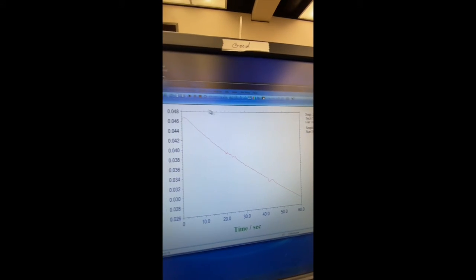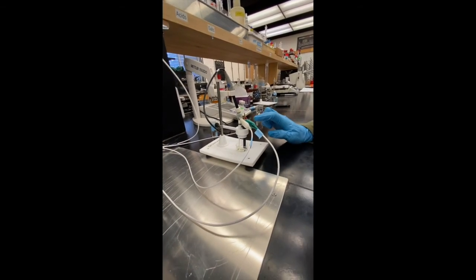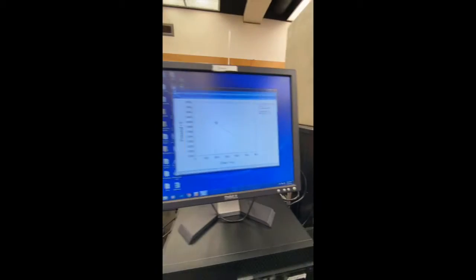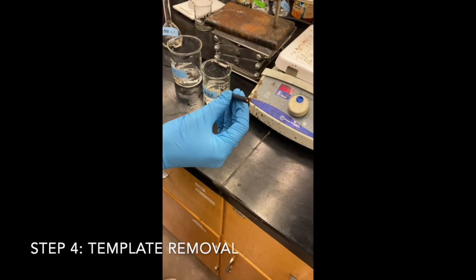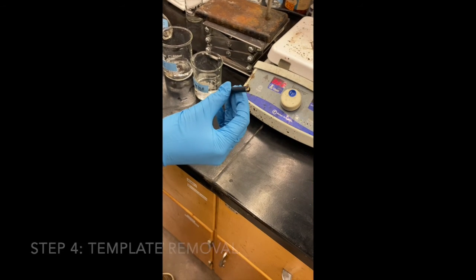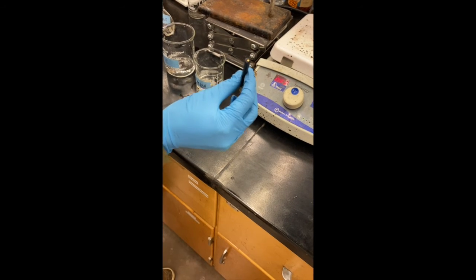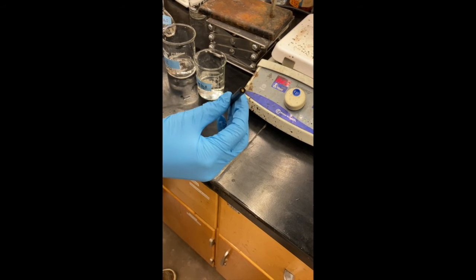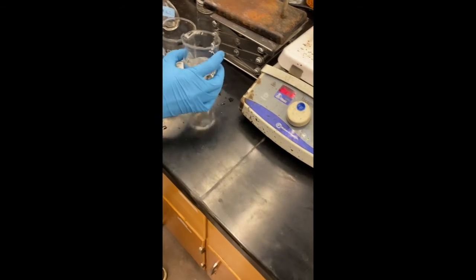Press OK. Again, check the cell over here. Check the contact, check everything is immersed, looks good, no contact up top. So now we're going to go ahead and press run. So we just finished the electropolymerization step, and now we're going to move on to the template removal. This is basically removing the analyte molecule from the sensor before we actually use it as a sensor and take electrochemical measurements. So to begin with, we're going to just rinse it with pure water.